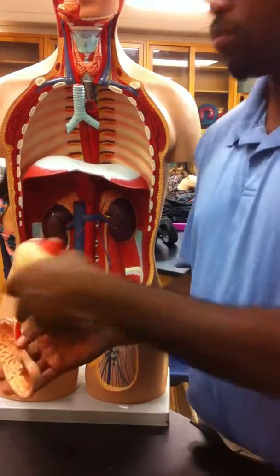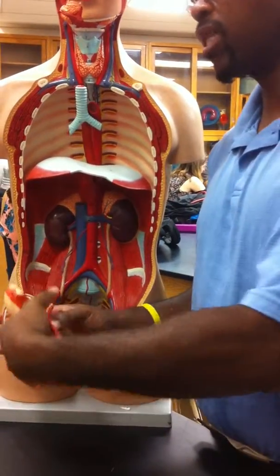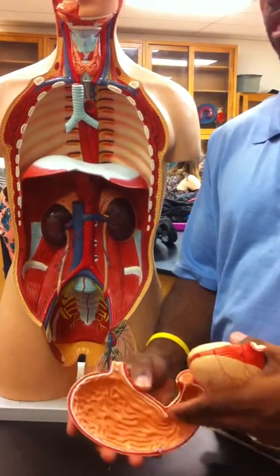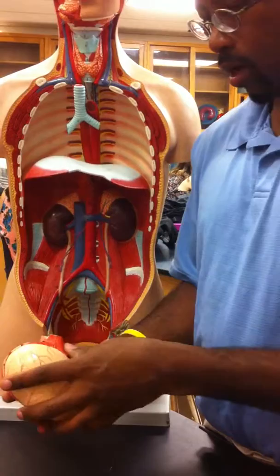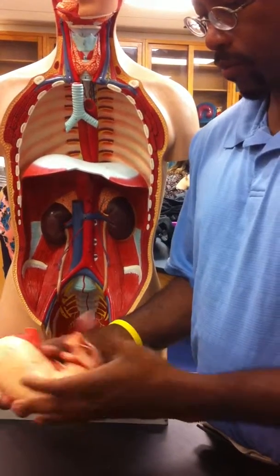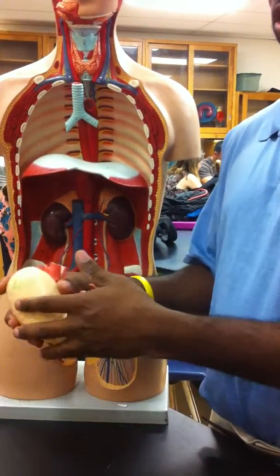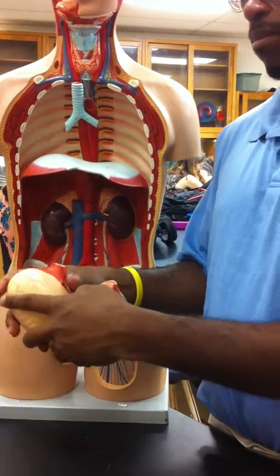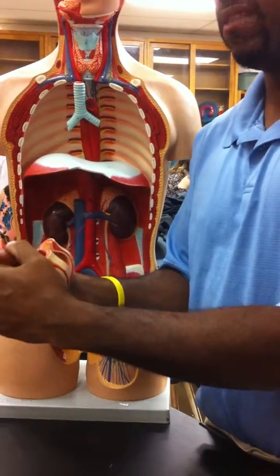Notice also all the rugae — the folds. Remember we'll discuss that in lecture. This is about the size of your stomach, except when it's empty it's completely flat.